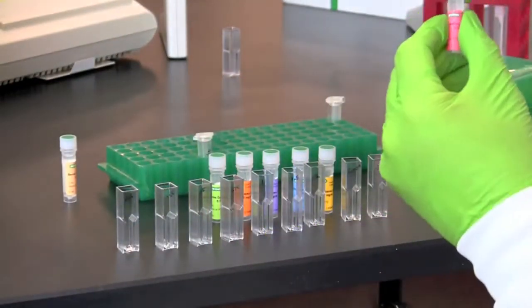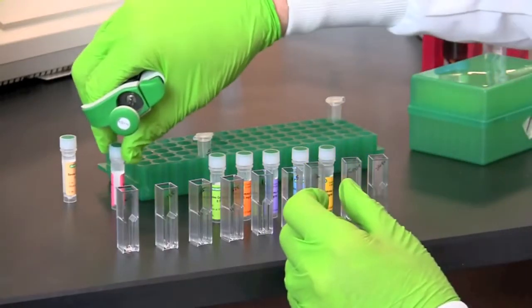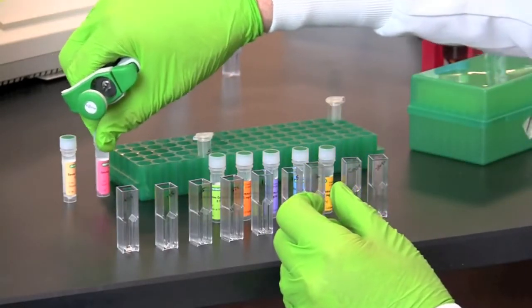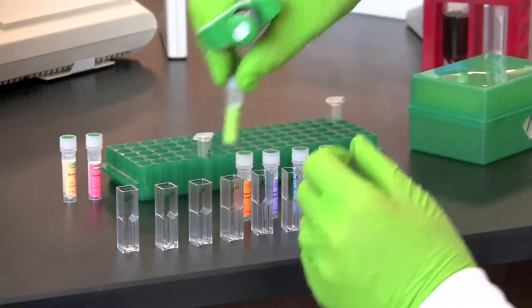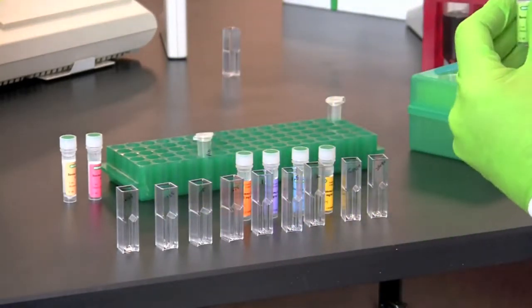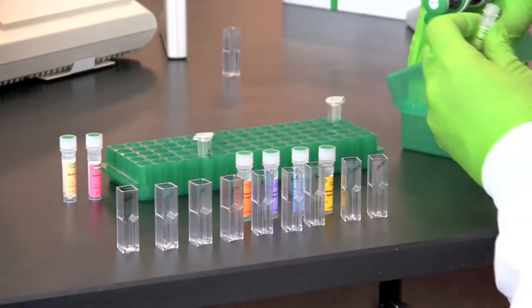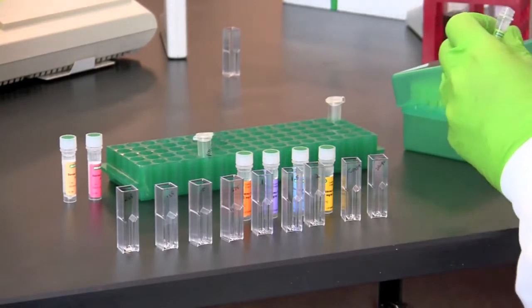Add 20 microliters of each protein standard into the corresponding cuvette. Make certain you use a clean pipette tip for each sample.